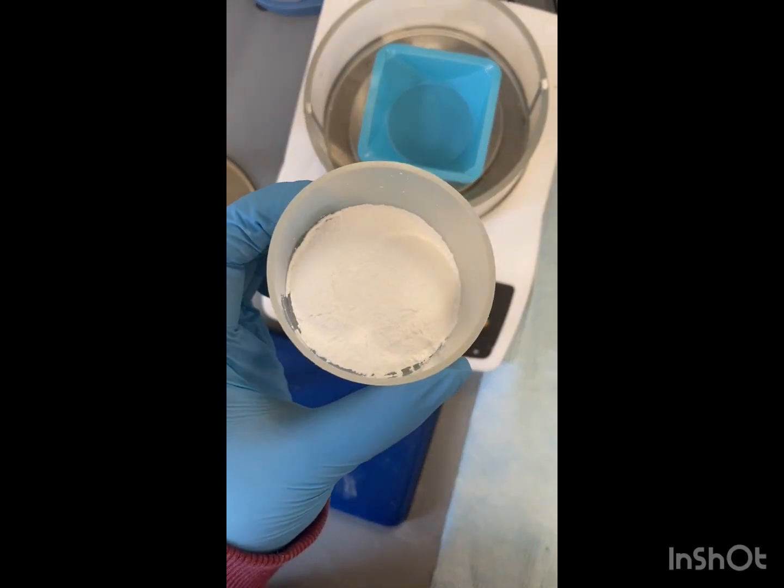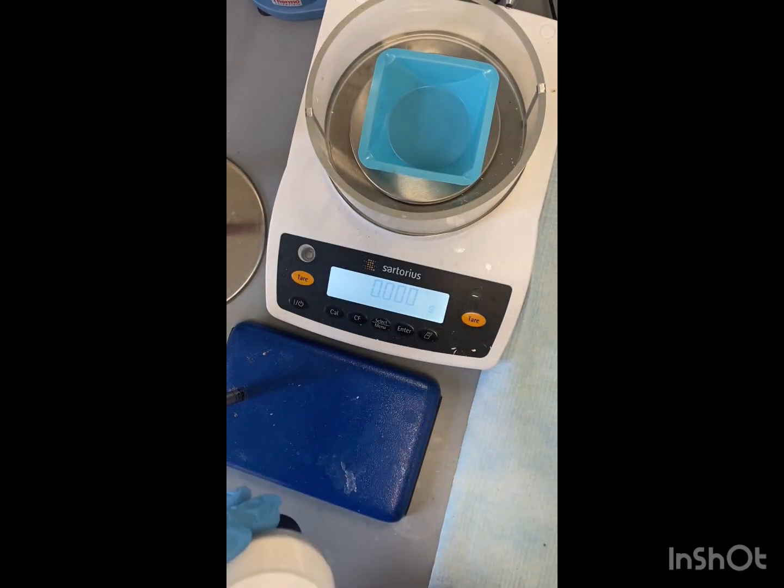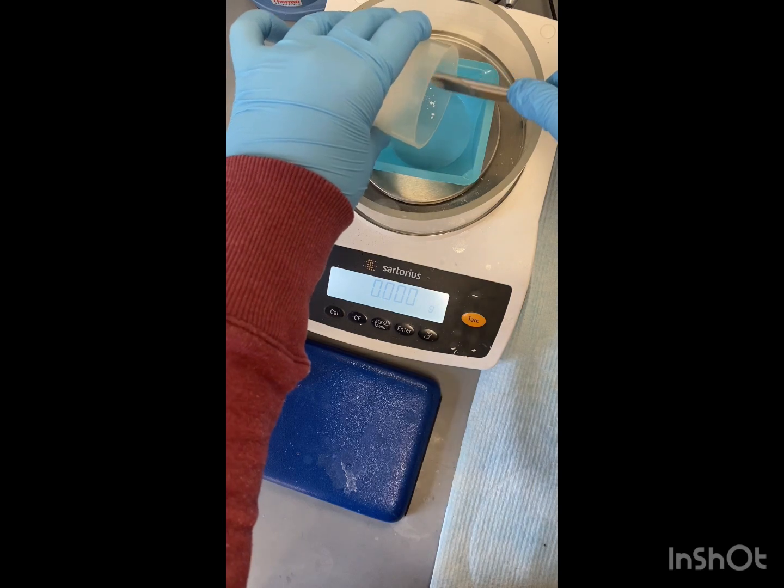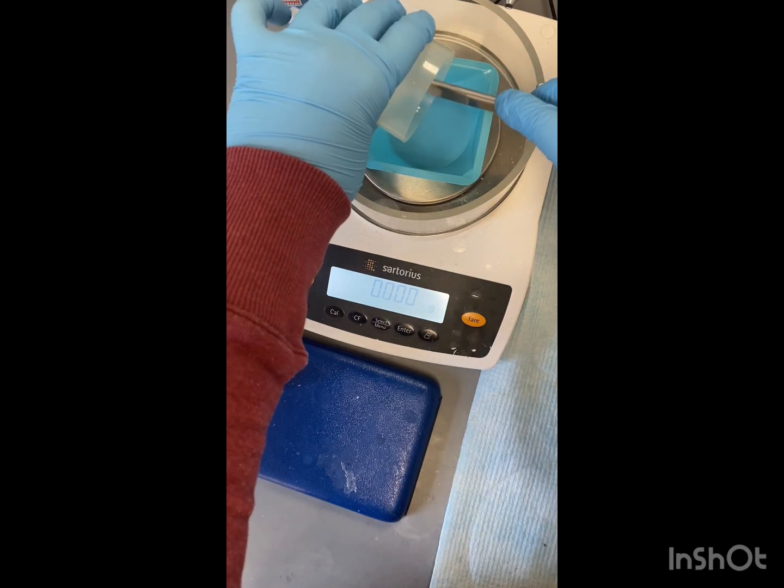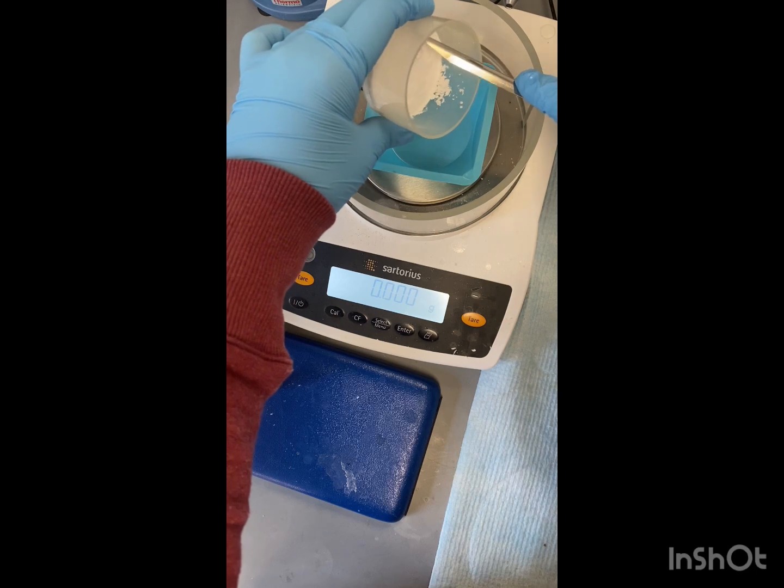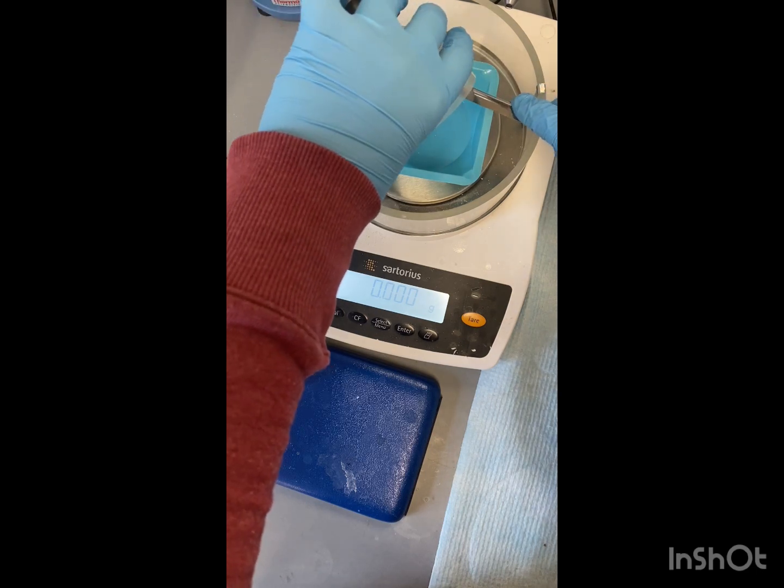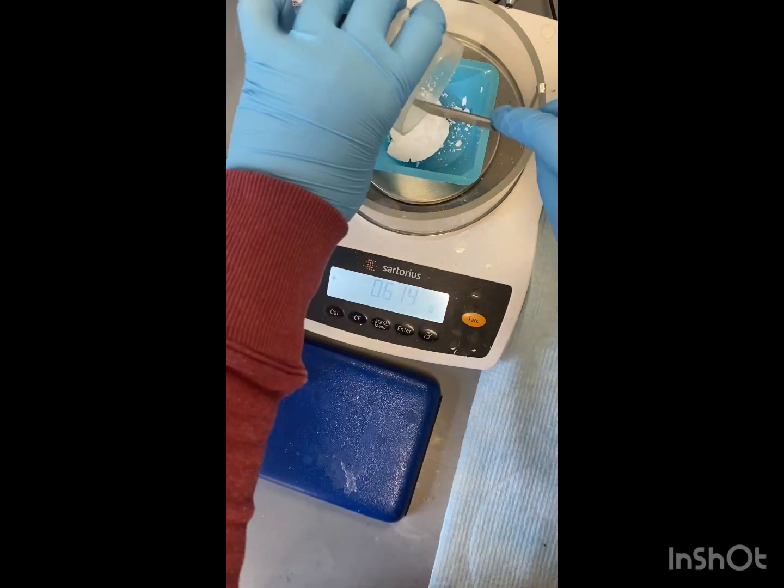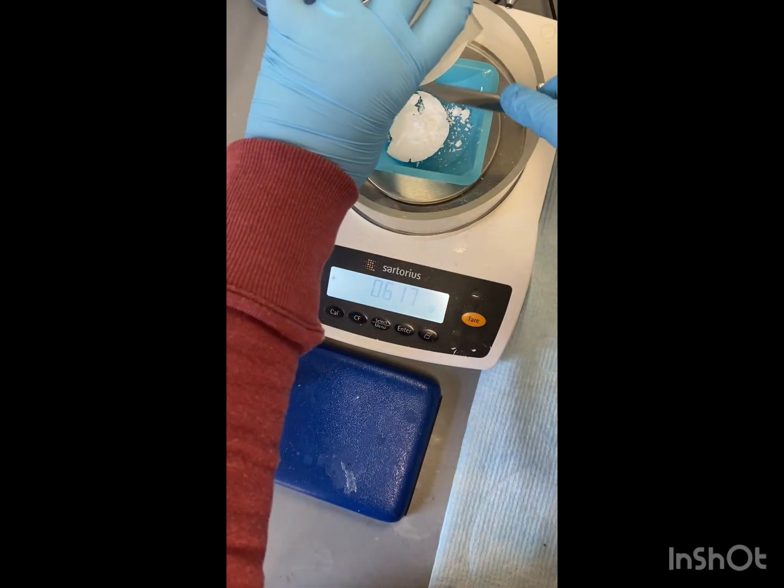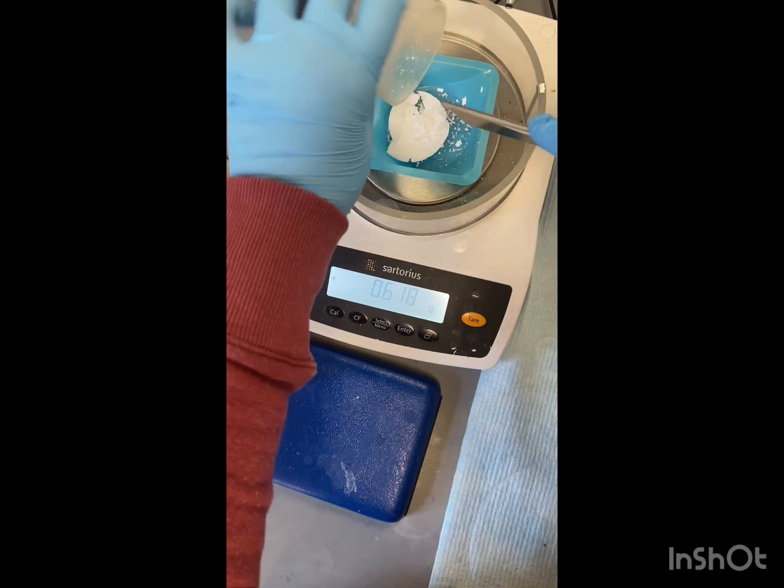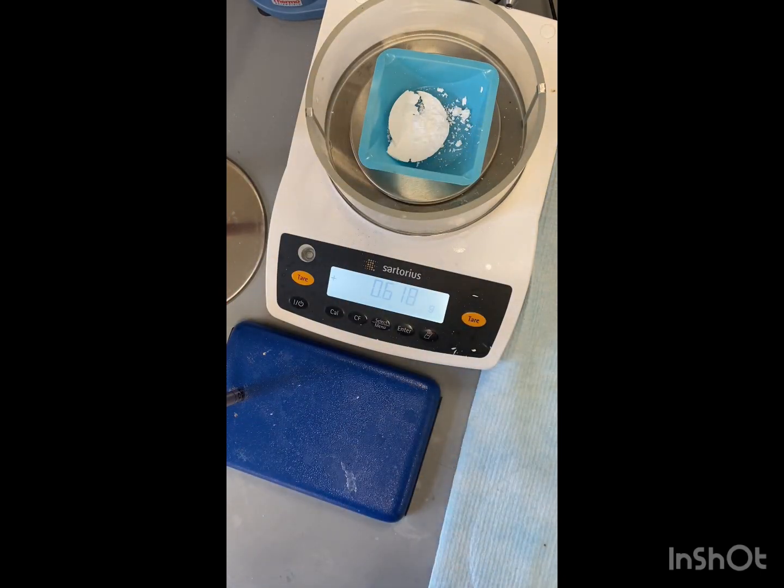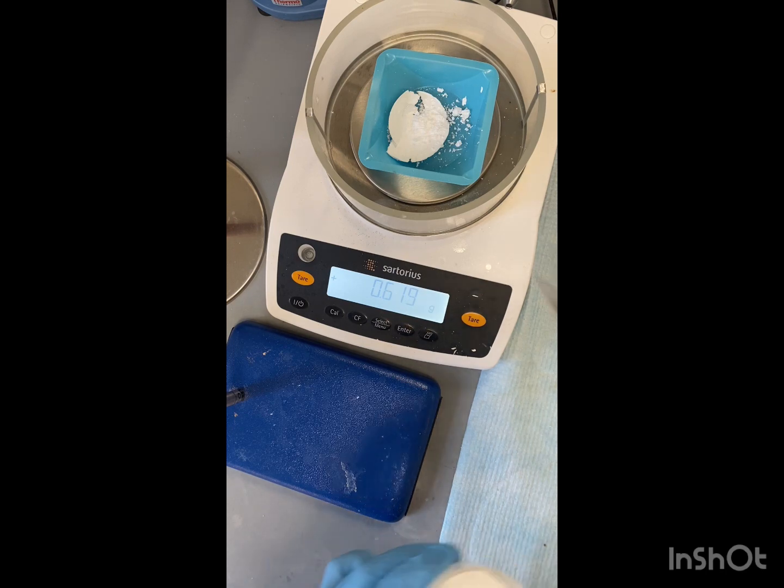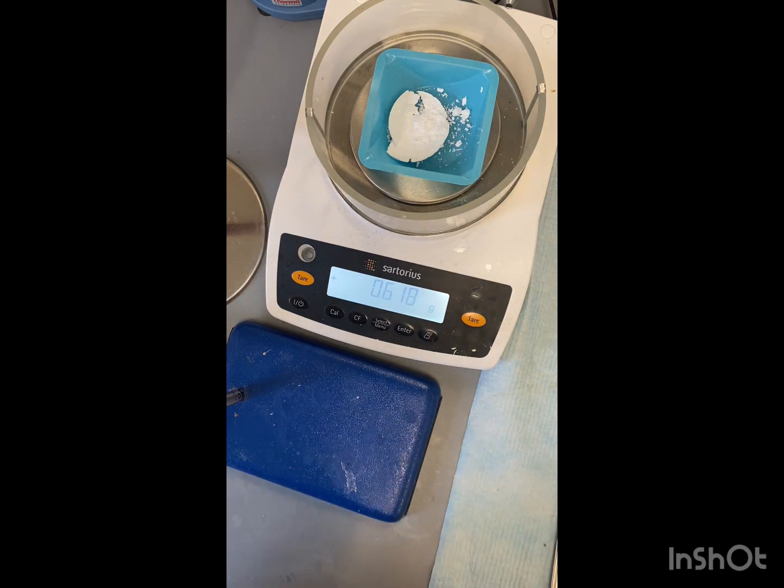Alright. Now that our solid is completely dry, we're going to weigh it out. I already have tared our weigh boat. So we're just going to scrape it in here. Alright. So we have a total mass of 0.618 grams.